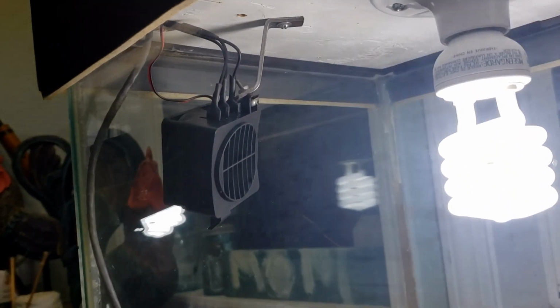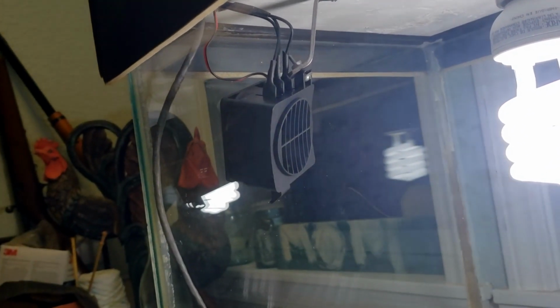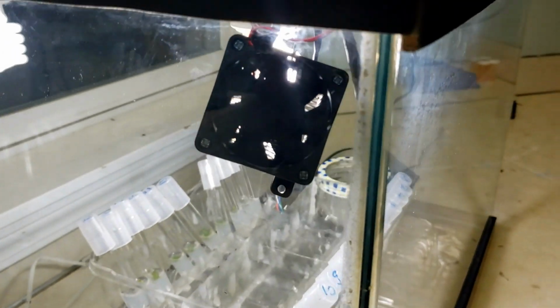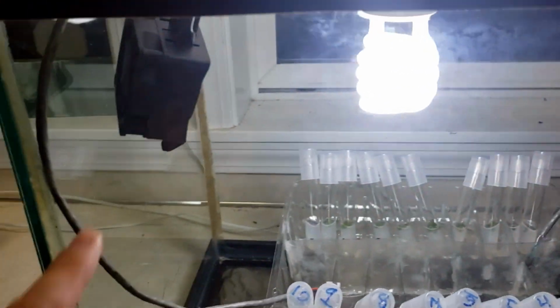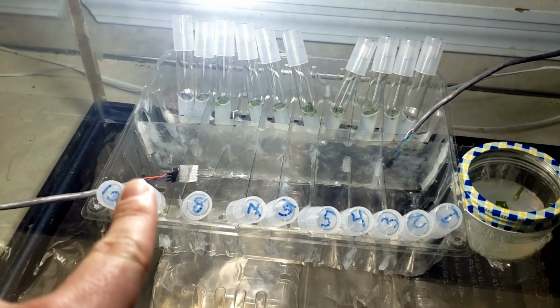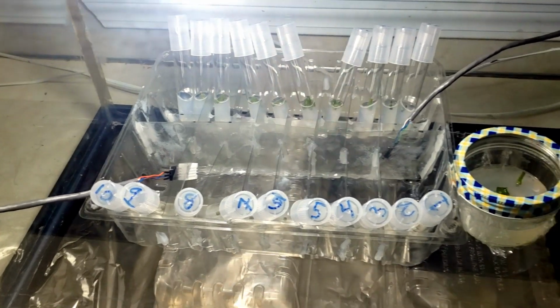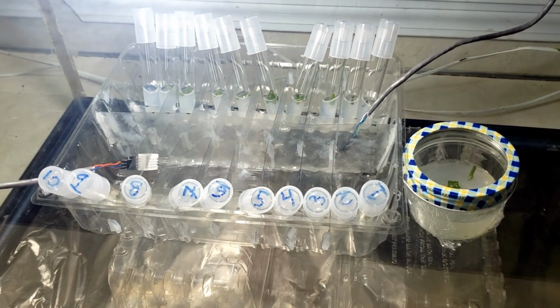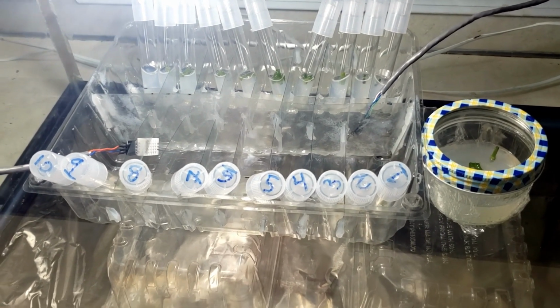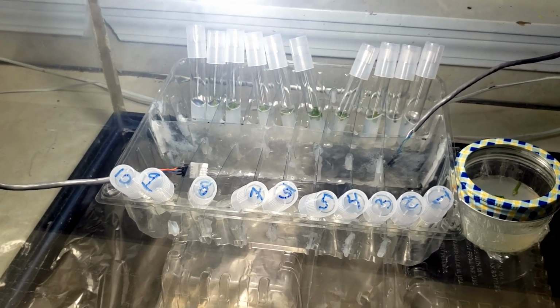And up here in the corner, that is our cooling fan and our heating fan, all in one. So I have one part of the controller that turns on the heater, another part that turns on the fan itself. And that fan is controlled by these two sets of wires down here, right there and right there. That is, I'm calling it temperature sensor one. That's actually a temperature and humidity sensor. And then the one over there is a different type of sensor, still temperature though. It just has a different sensing element. So I have a little bit of redundancy built in so I don't accidentally fry one location in my growth chamber.